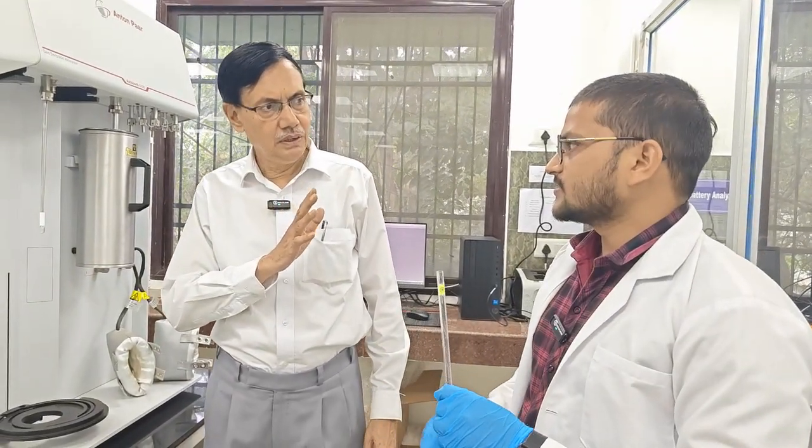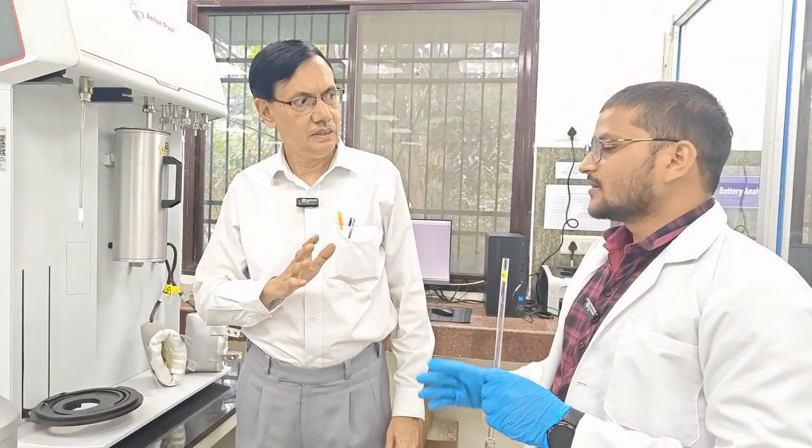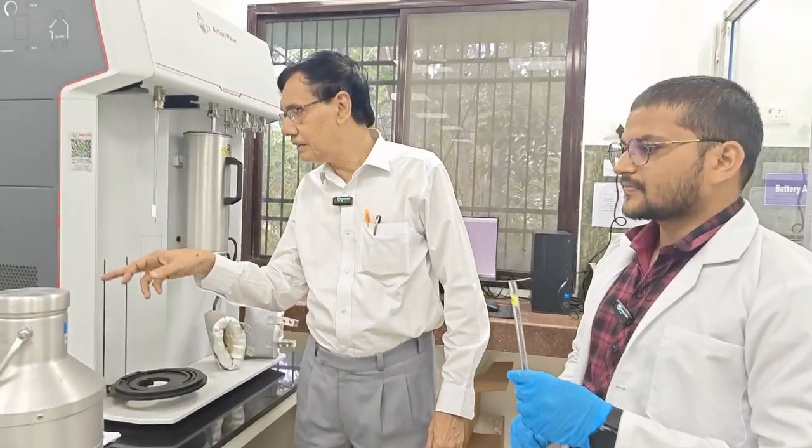Your sample is a solid sample. And you have a polymer sample or no? Yeah, it can be polymer also. It can be film also. It cannot be liquid. With the exception of liquid, anything can be done. And there are many sample tubes.